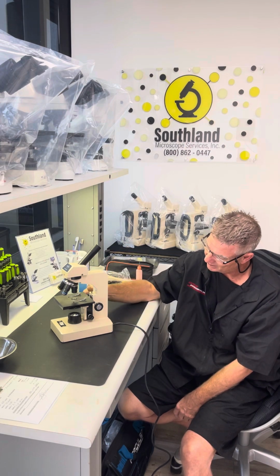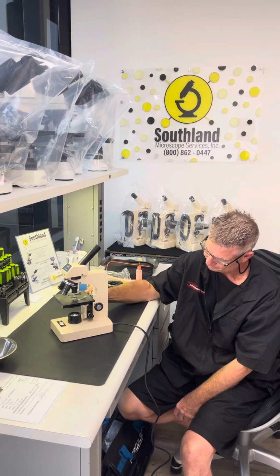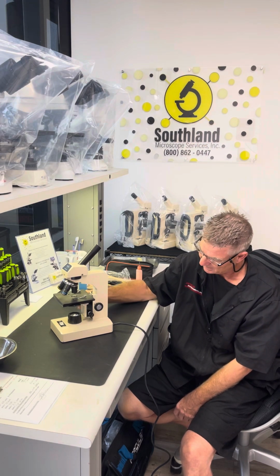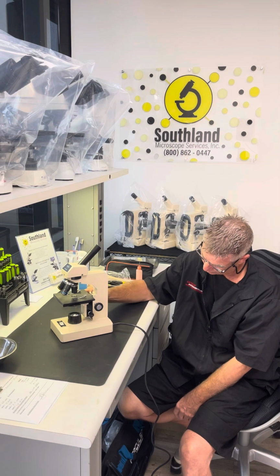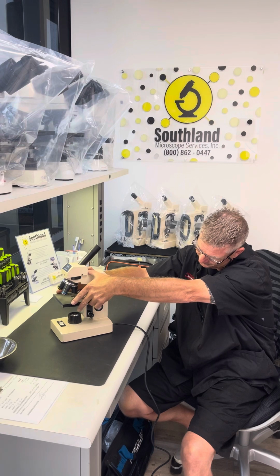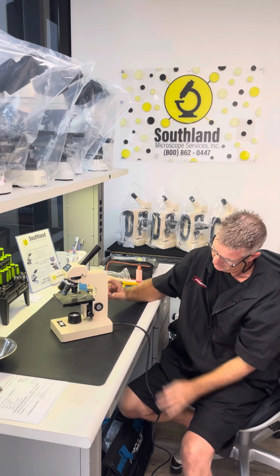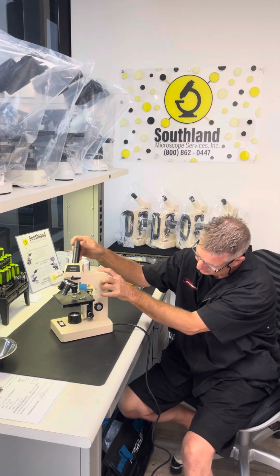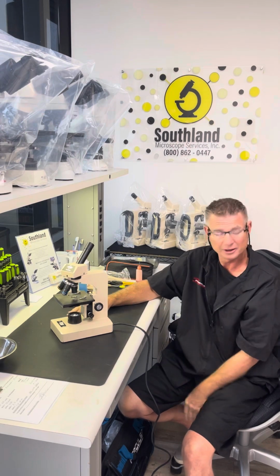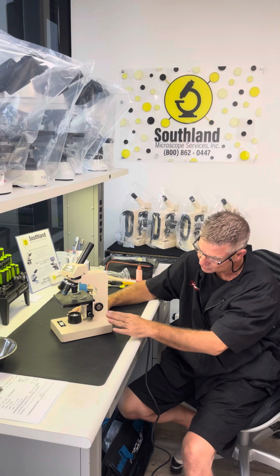The next we have on it are the mechanics. We have a rack and pinion. This is the coarse adjust. This is the fine adjust. That's the mechanics. It rotates both sides.